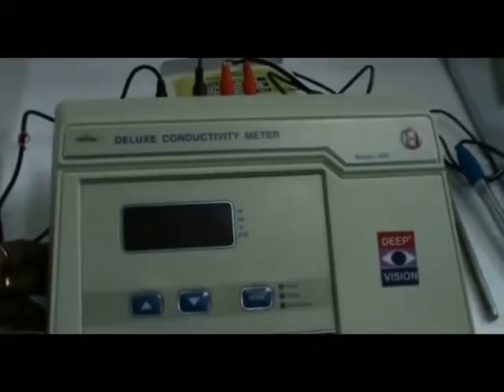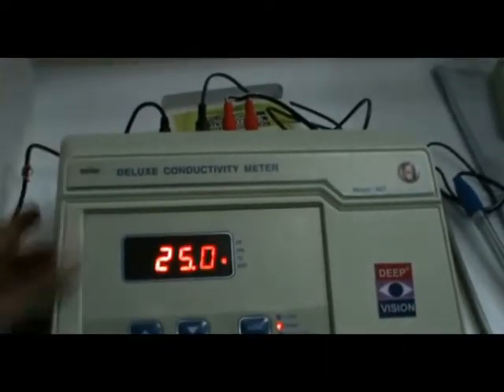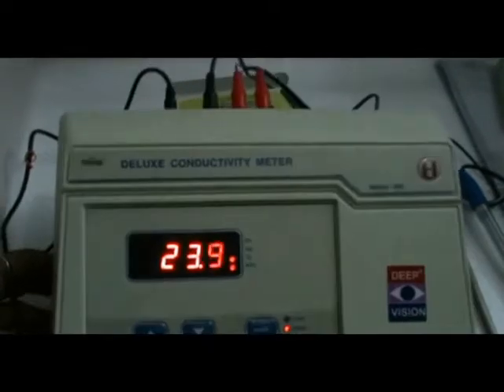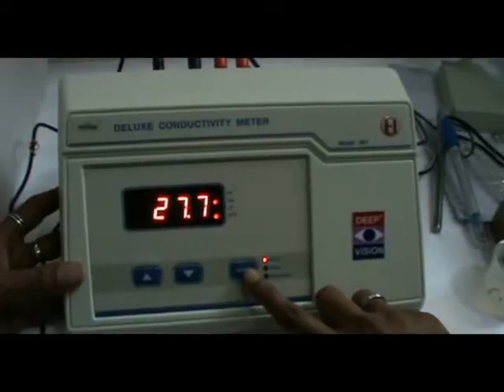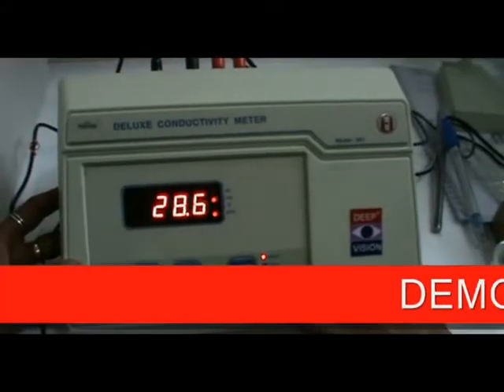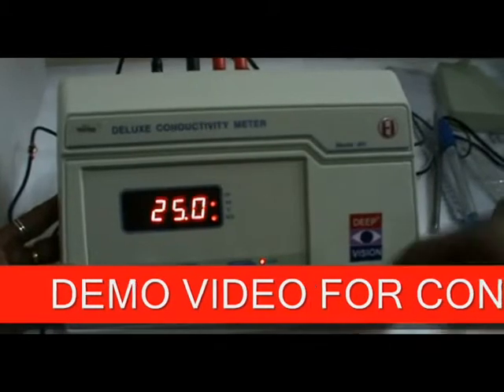Switch on the instrument. Now press the Mode key to select the conductivity mode.